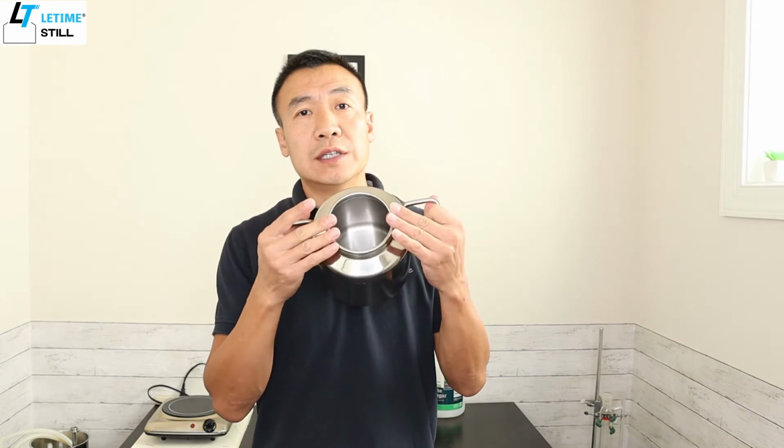So you see, after boiling the white vinegar for 15 minutes, and then using just the pad to scratch with detergent, you can recover this pot back to shiny.